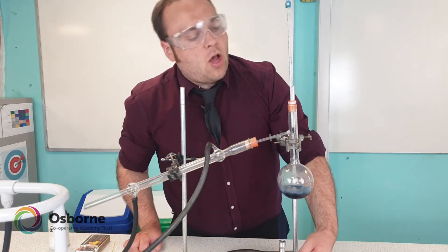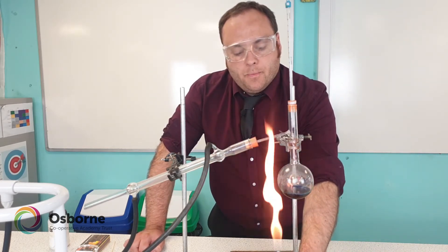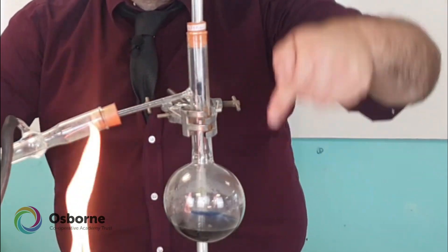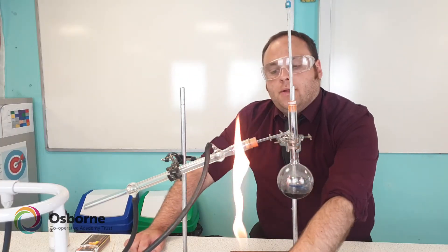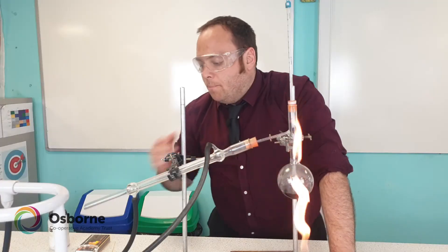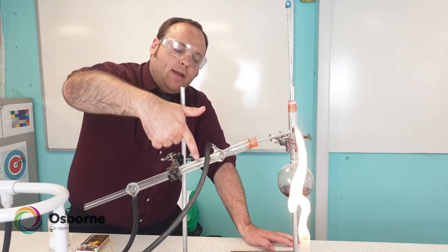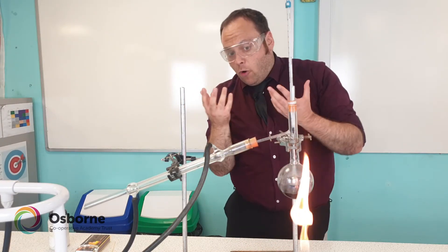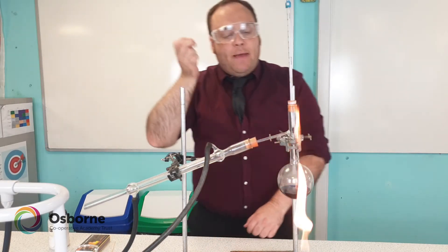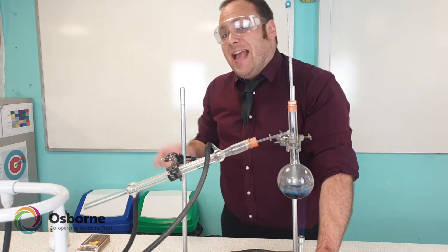The temperature at the top has reached very nearly 100 degrees, meaning the steam at the top is very nearly 100 degrees. I'm going to move the Bunsen burner away now because I don't want this to over-boil. You can see steam starting to condense at the top and drip back down, and even more condensation forming on the inside of the condenser — which is exactly what we want. I'll keep giving it a few doses of heat until water starts to actually drip at the other end of the condenser.